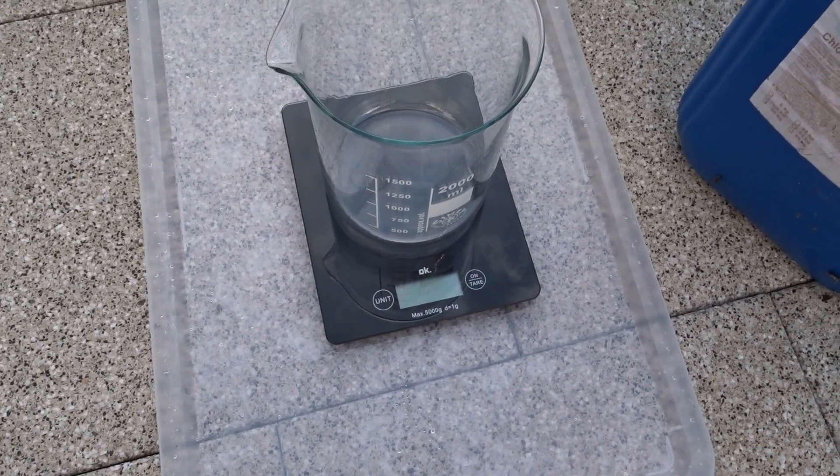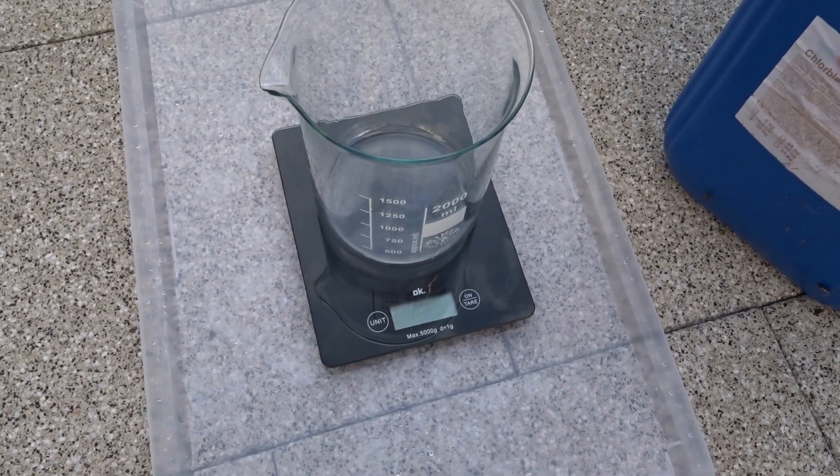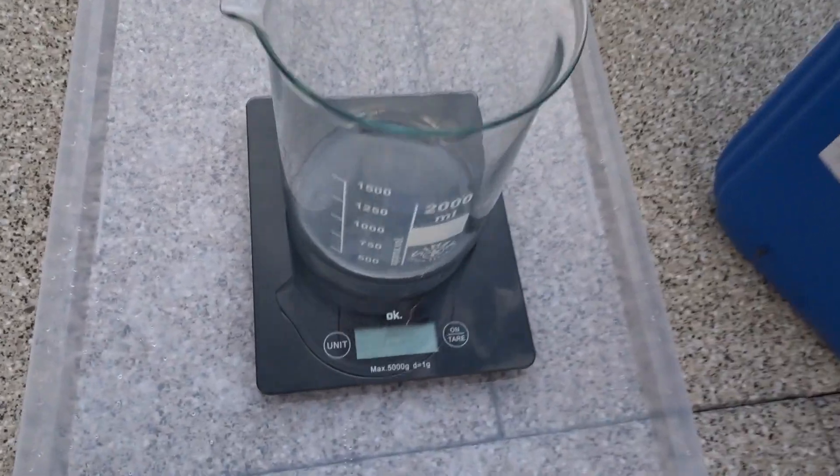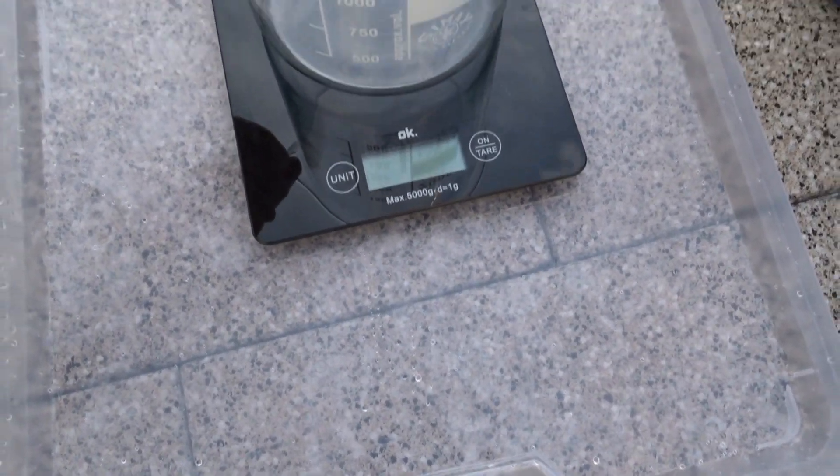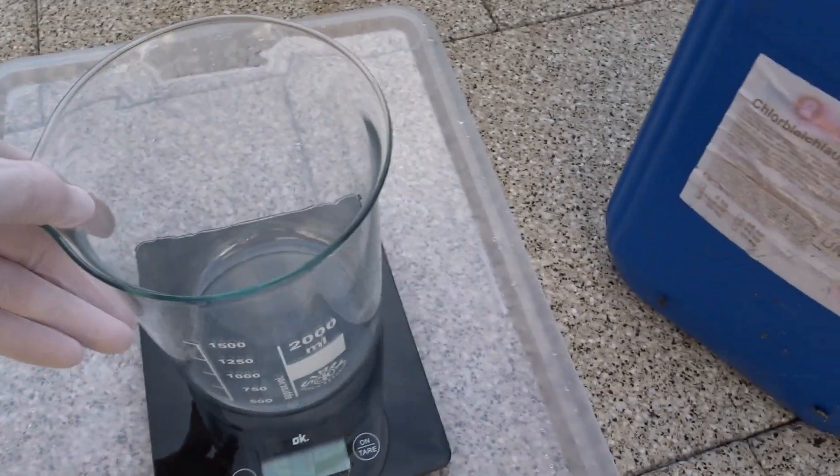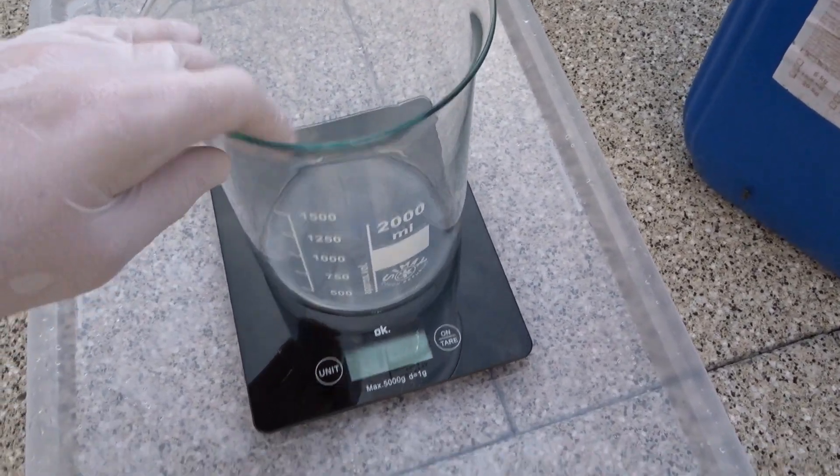Today I'm going to do the haloform reaction. It's not like this reaction hasn't been done on YouTube yet. There are plenty of probably better videos than this one, but I need the chloroform.